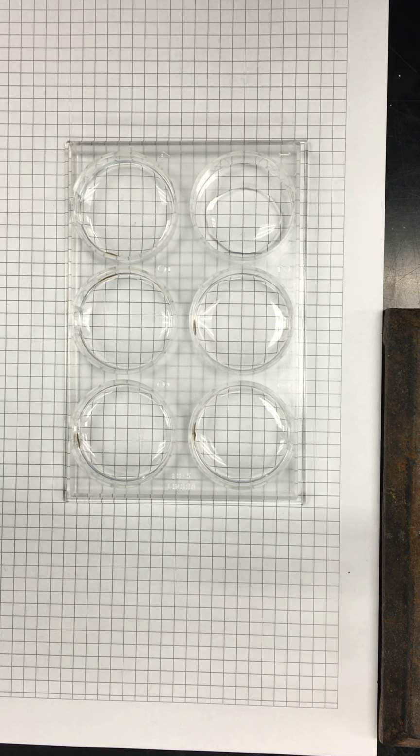That's why I'm a little confused. I'm confused at what your target concentrations are. Yeah, those are the targets because we took them straight out of the paper, like the ones that they got the most results with. So that's 10 to the minus 2, which is basically 100 millimolar. So then we dilute these and these, right, to make that? Yeah, so this will be tenfold more dilute. That would be 10 millimolar, not 100. 10 to the minus 2.